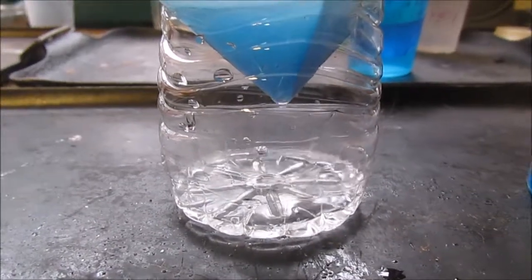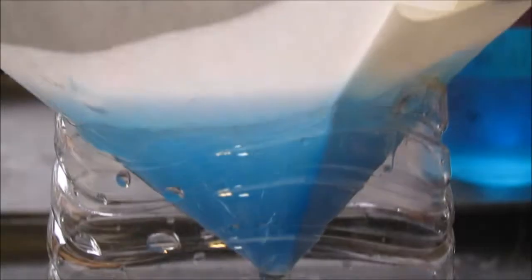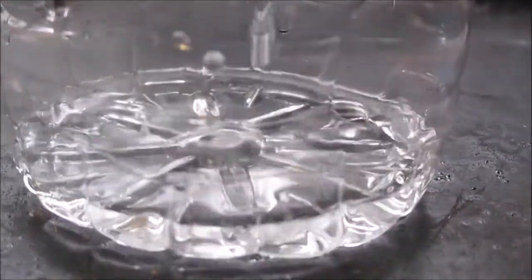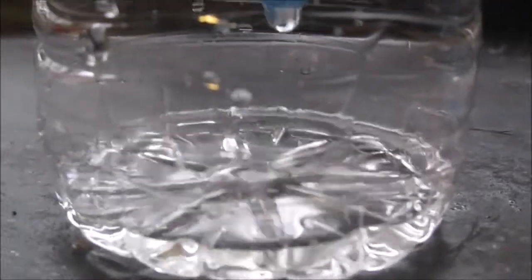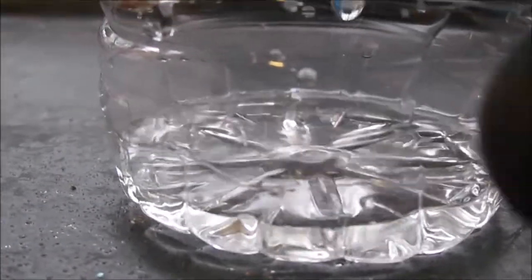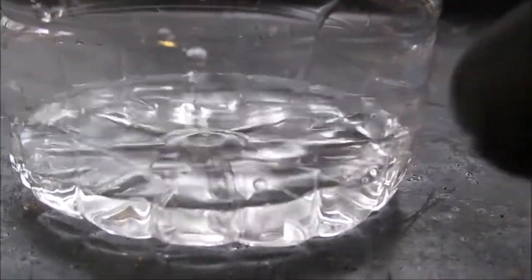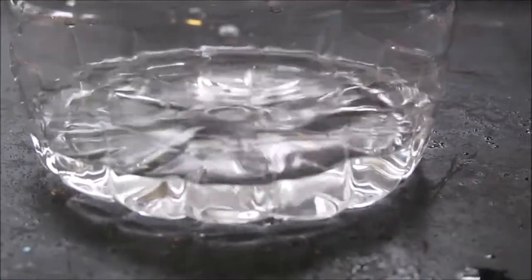Here you can see the solution coming out through the filter is totally clear. That demonstrates the fact that this is indeed a suspension rather than solution. So what that shows me is that I had a very large excess of sodium hydroxide, which I know I did, because this is probably still very basic because it has not neutralized all of the, or rather all of the copper sulfate was neutralized, and the hydroxide was not.